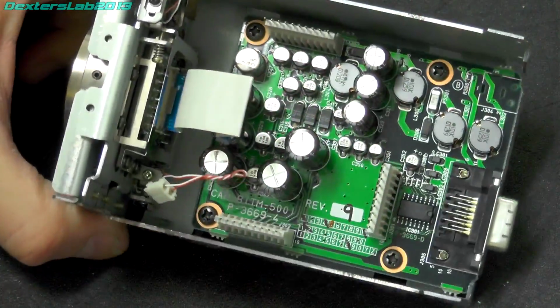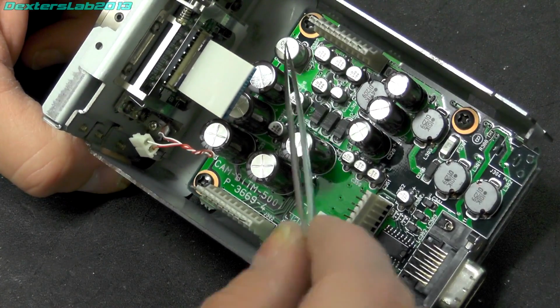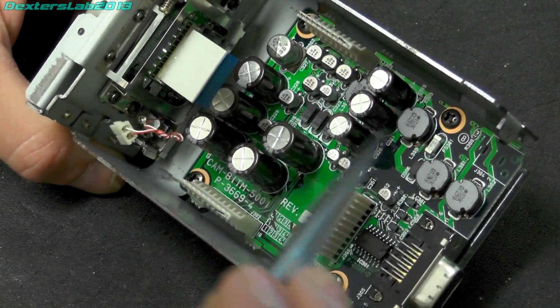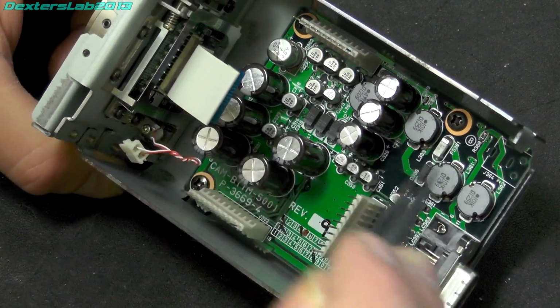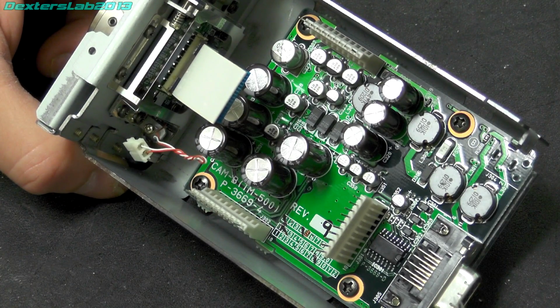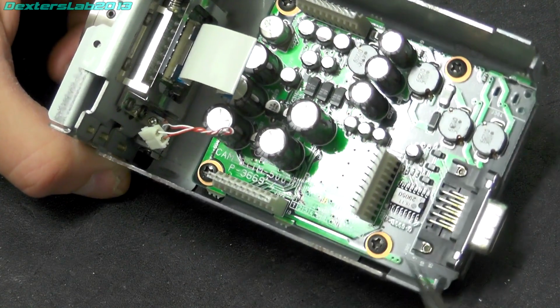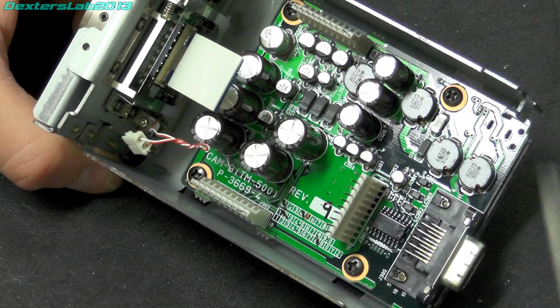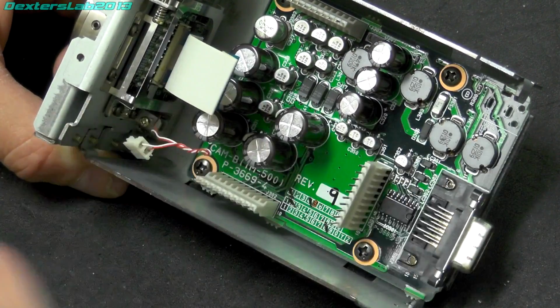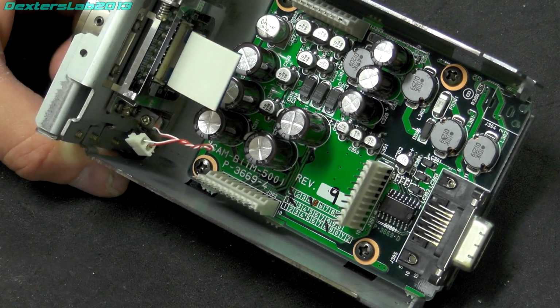Right, well, there's not a lot going on the bottom there. It looks all like power supply stuff to me. Lots of capacitors, inductors, and diodes and stuff. So that looks all about power supply to me. So obviously the interface board on the PC would be supplying power down this cable. So that's probably going to be something like 12 volts or something maybe, and then this will regulate that down to whatever you need for the CCD and all the electronics that control it.